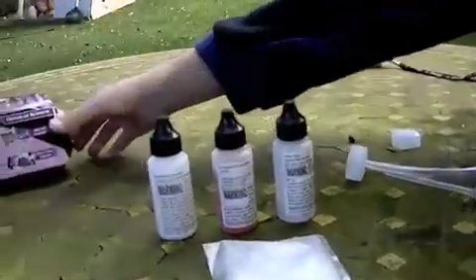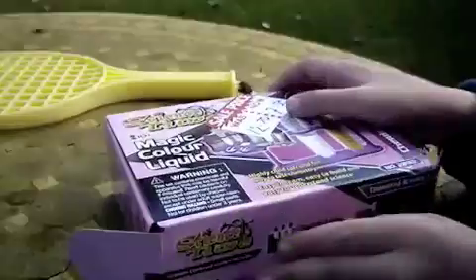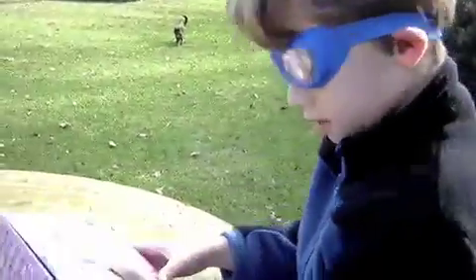Let's see what this is — this one is calcium hydroxide. Yes. This bottle contains bicarbonate indicator. Yes. And this bottle contains citric acid. Yes. And in this bag we've got some small marble stones. Yes. We have the box that it came in and it's called the Magic Color Liquid.